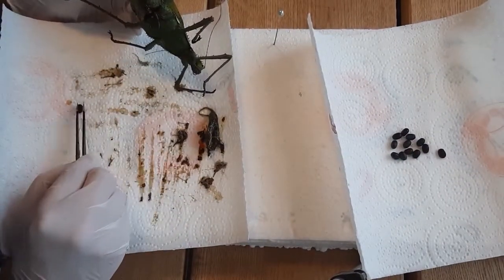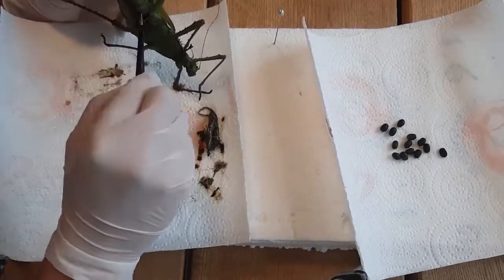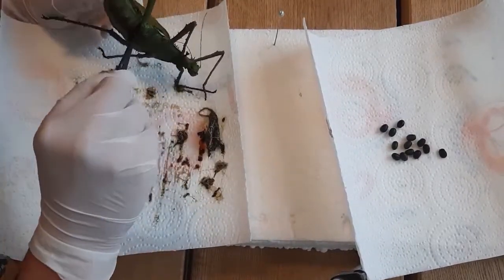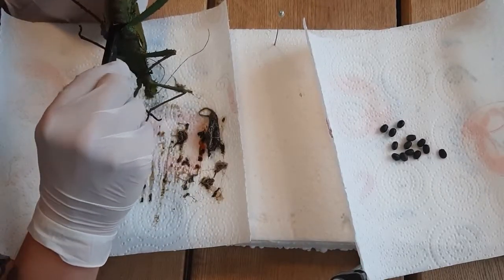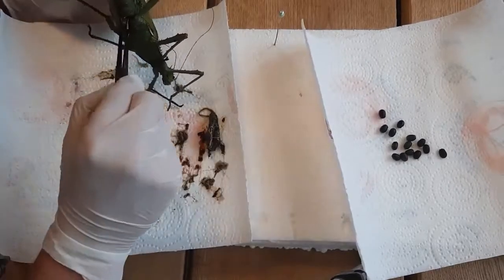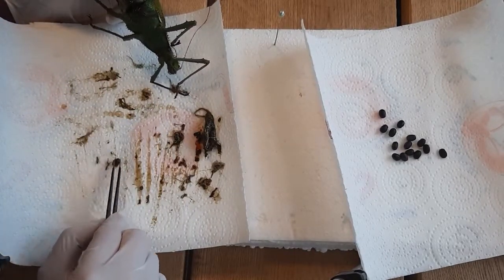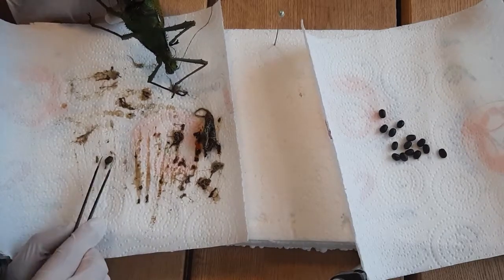It's never for sure, but we will see what happens. With these eggs, if you want to save them, be very careful. You would think they are hard — they look like seeds and feel a little like seeds — but they are very soft on the inside. If you squeeze too hard with your tweezers, the eggs will break.